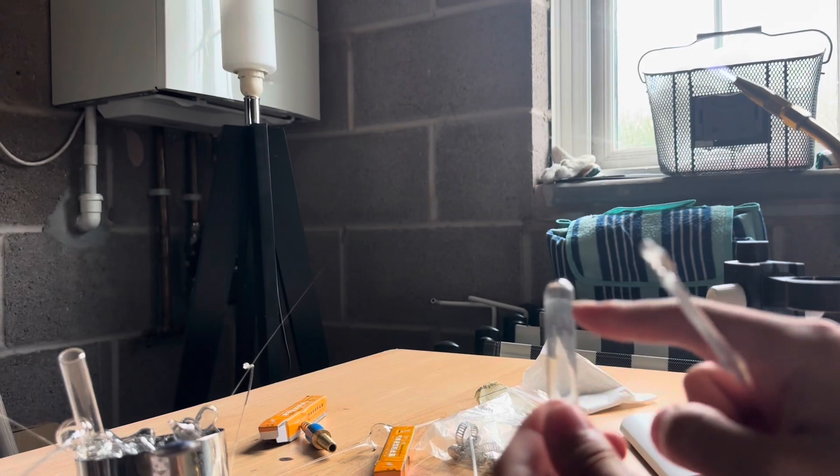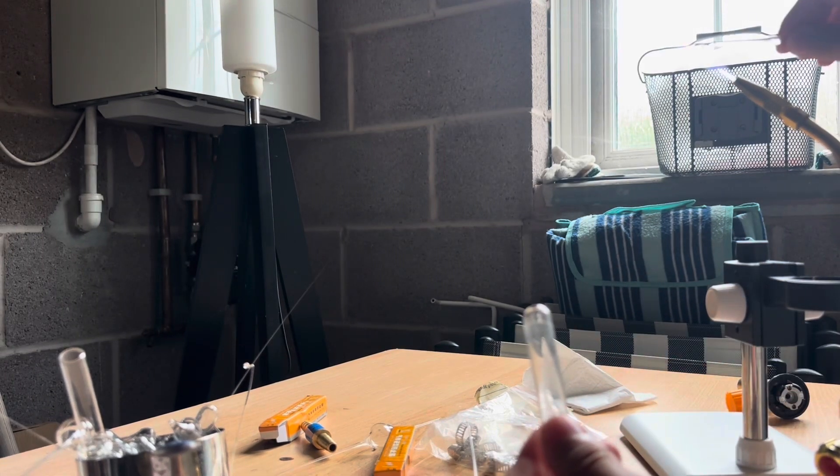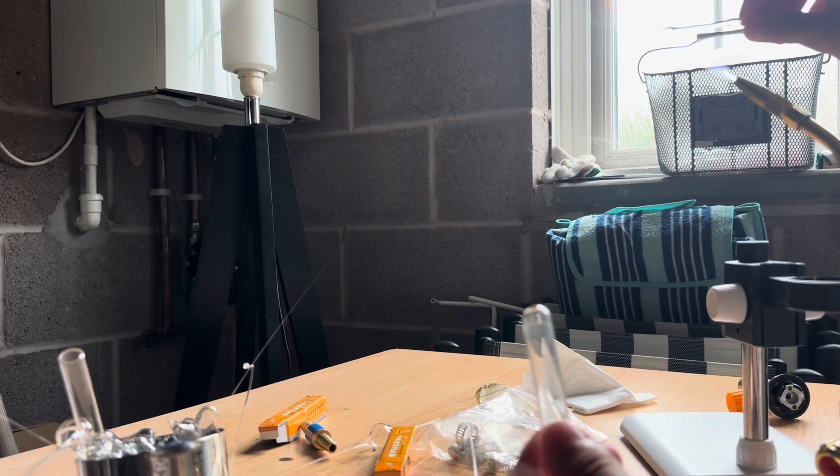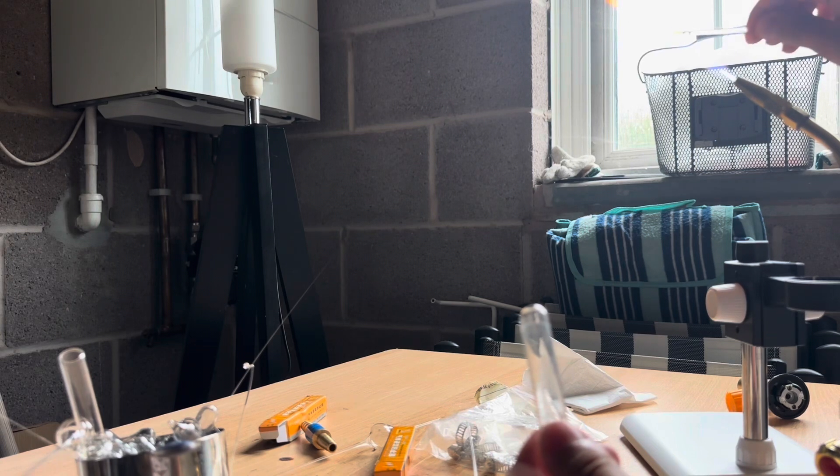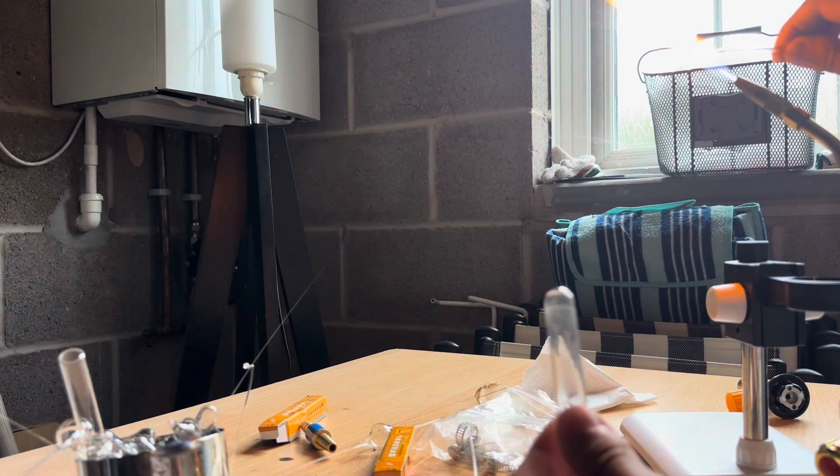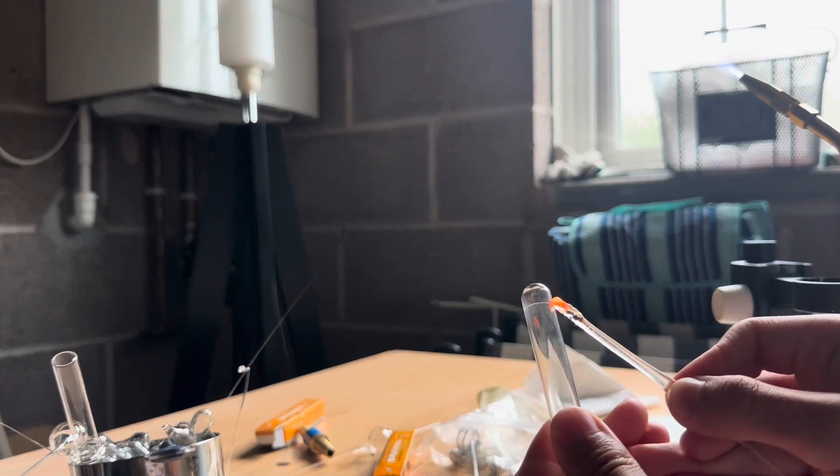So here we can see it's our score line. We heat up the glass. First, in the cooler portion of the flame, so we don't crack the glass to begin with. You eventually just get the glass just about to melt. That would be good enough and put it around the scratch.